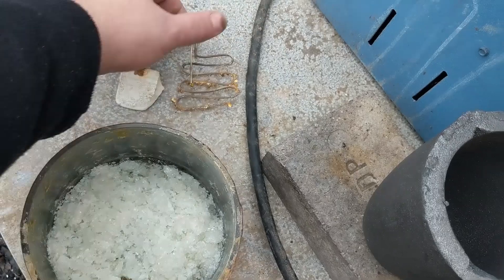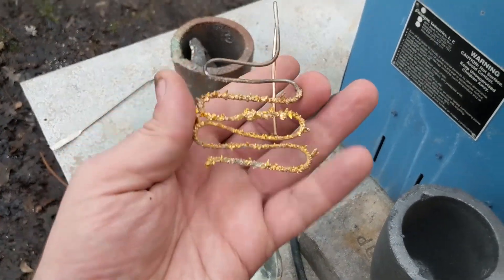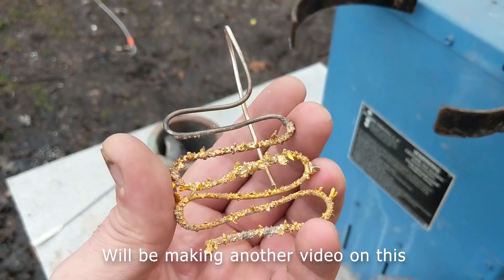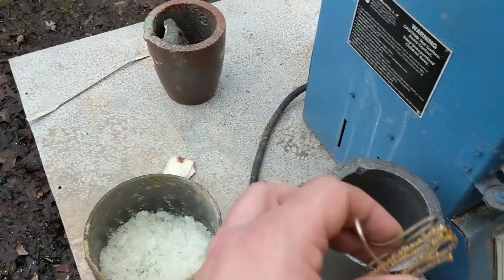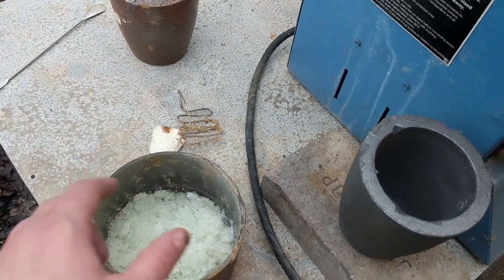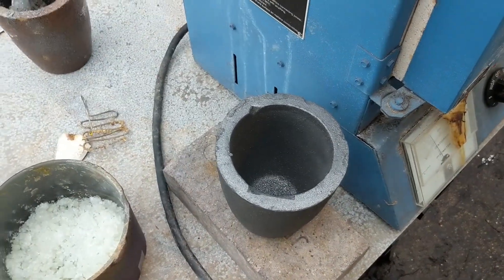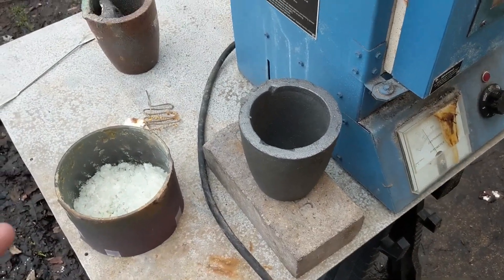So I've got the anode, and this is the cathode that I was growing from. I don't know why it took on the orange color — that's something I'll have to look into further — but that is going in here. Like I said, all the silver nitrate as well as the paper, and I'm hoping for around 20 ounces. I'm making water shot with this so I can use it in just bits here and there on future projects.